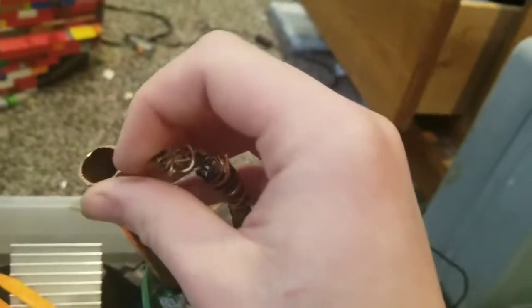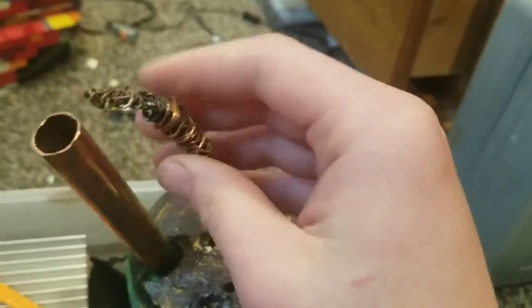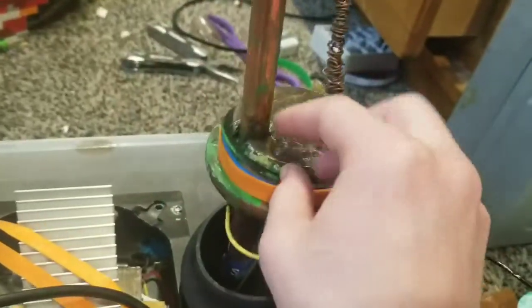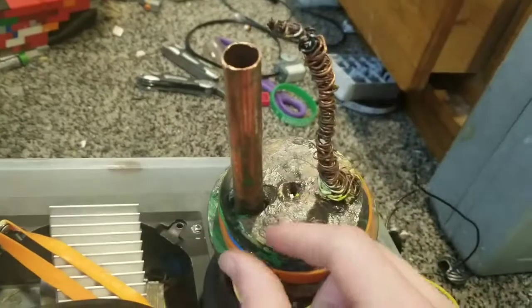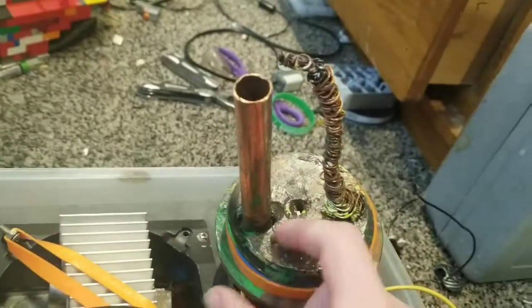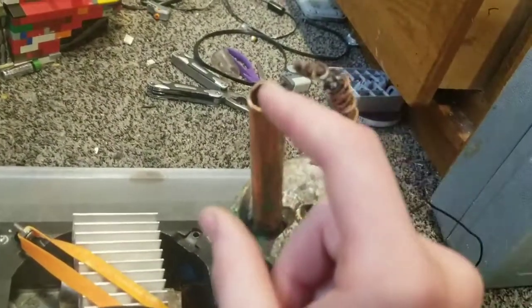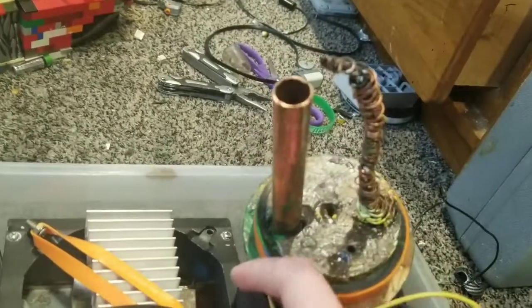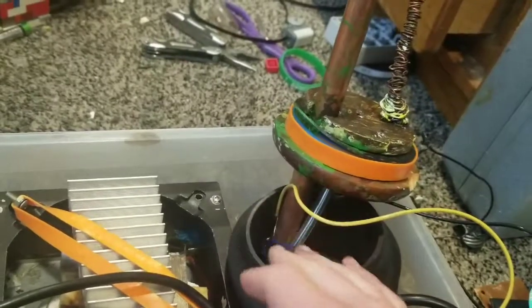Next, we have the electrodes. So the power from this goes down here, and this is the first electrode. I took all of my copper wires and I strung them into a single electrode that is nice and thick, and it's got a lot of heat dissipation, and it's a very good electrode. The second electrode is this pipe, and we can suck air down through it. So air comes in this pipe, and it goes up into this pipe, and it gets ionized by the electrical arc and turned into nitrogen oxides, which when bubbled through water produce nitric acid.